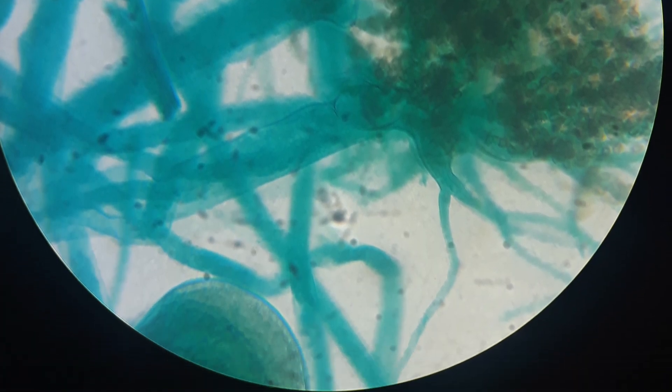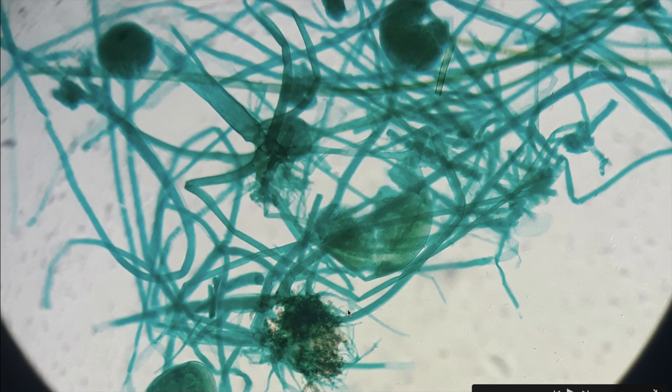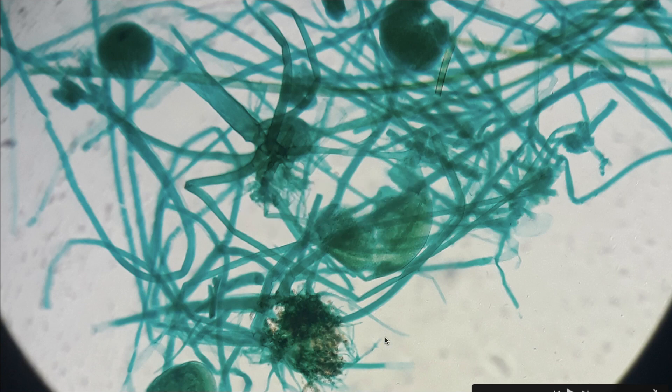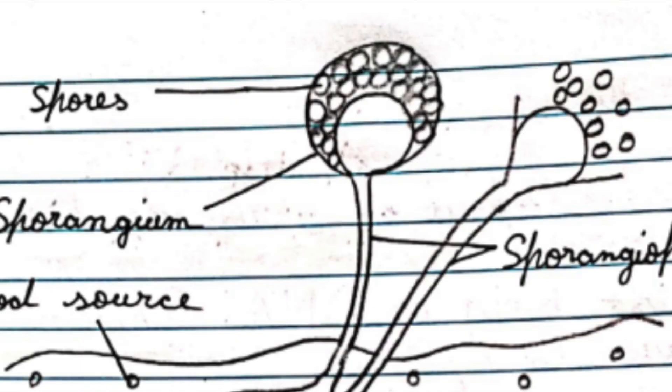These are the spores — reproductive cells that grow into new fungi and are agents of asexual reproduction. These are the round dots that you see on your screen.